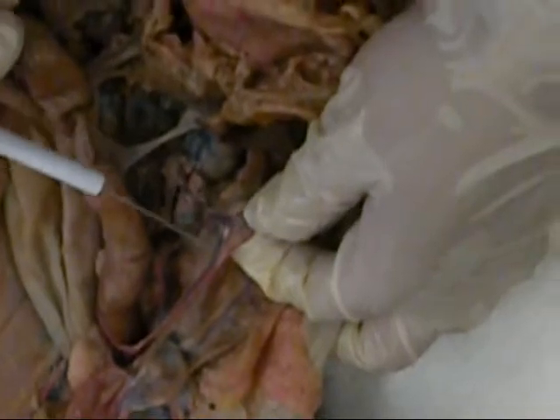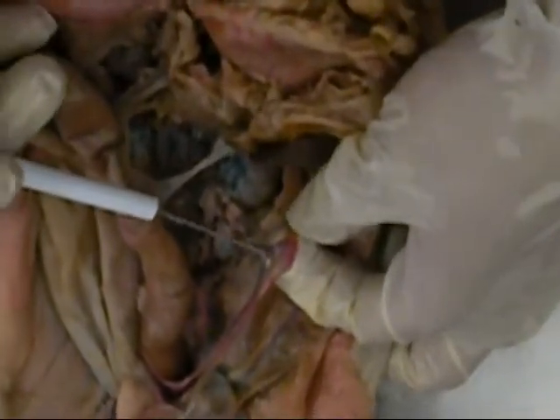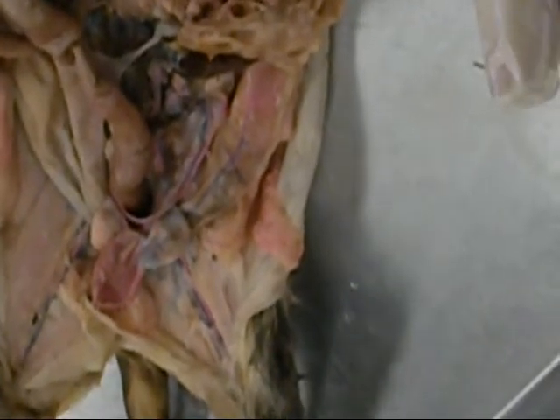So our ovarian, you can see here that big broad sheet ligament. Actually, I don't think that's on the study guide. With the male structures, you would be doing the gonadal vessels, the penis and testes, and the penis and testes obviously are going to be external structures for the male.